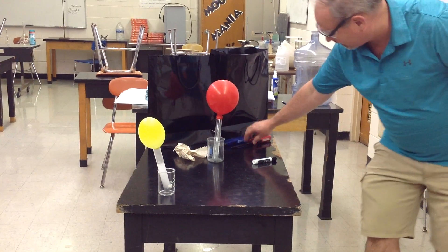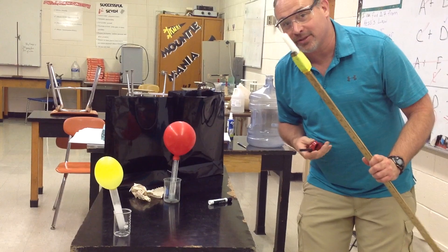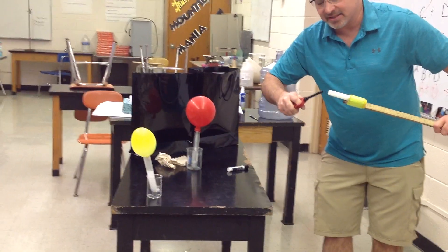I've got a handy-dandy lighter here and I've got a candle on a stick. So let's go ahead and light this candle on a stick.